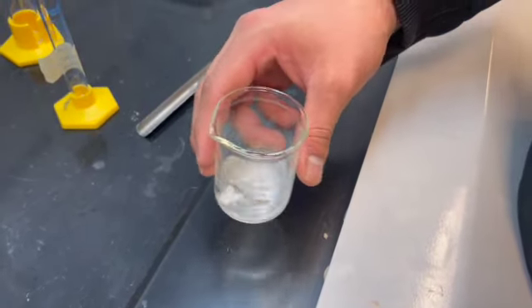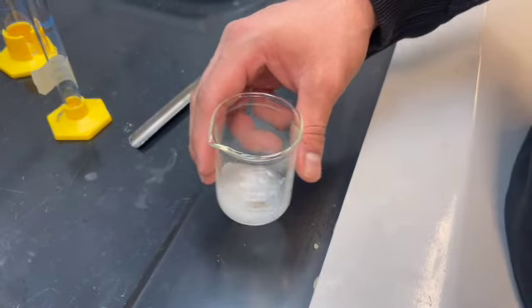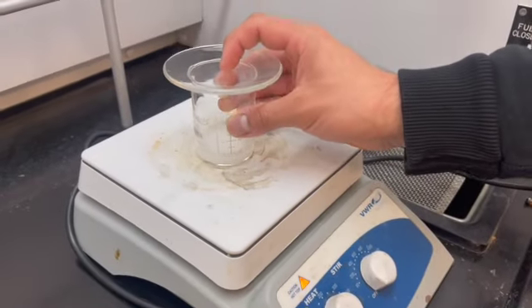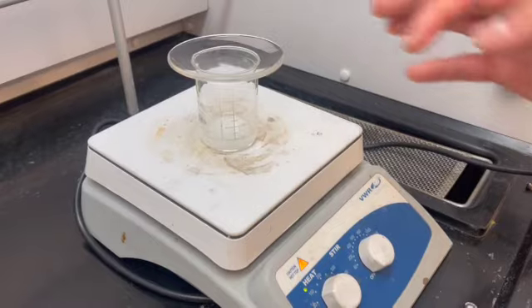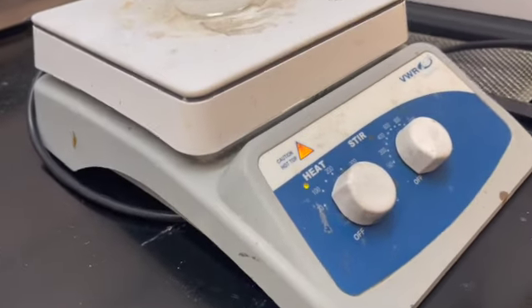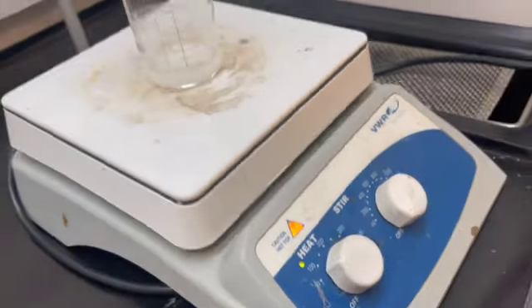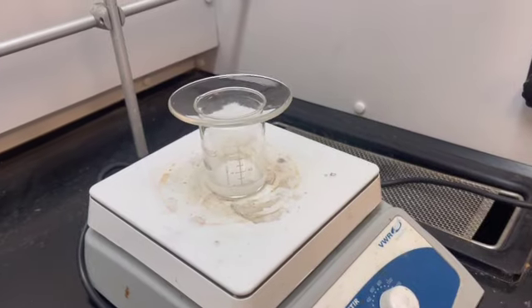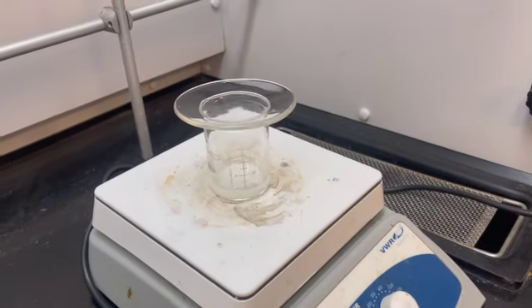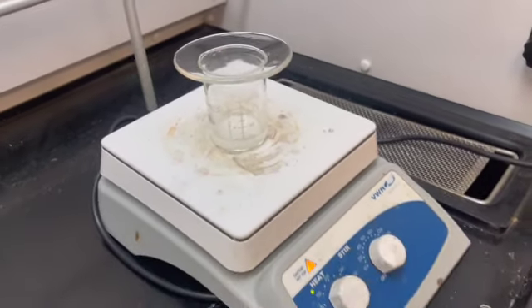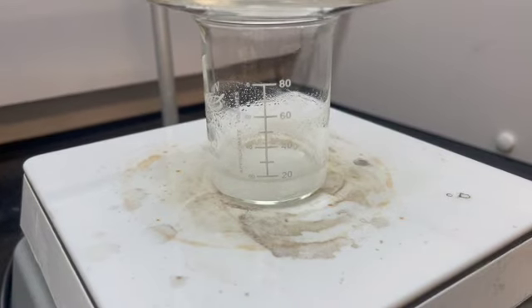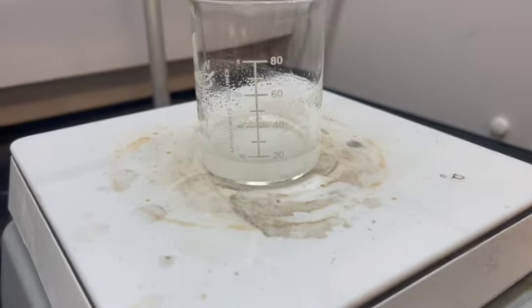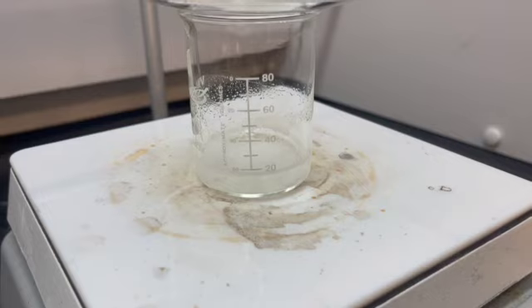We're putting our mixture onto a hot plate, and it's around 100 degrees Celsius until it boils. And now our solution is boiling, and we want it to boil for a few minutes.